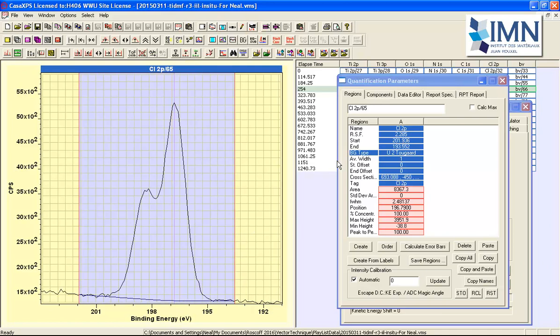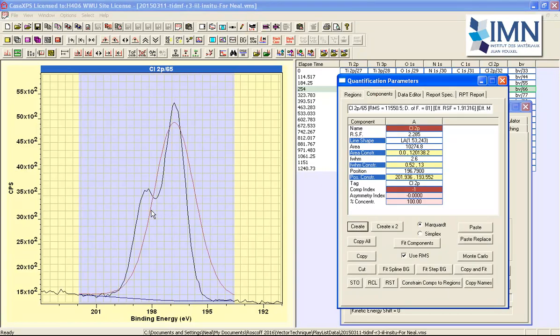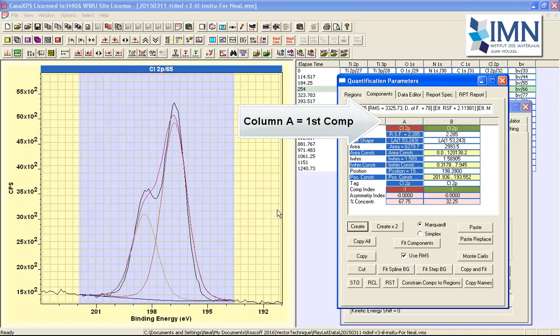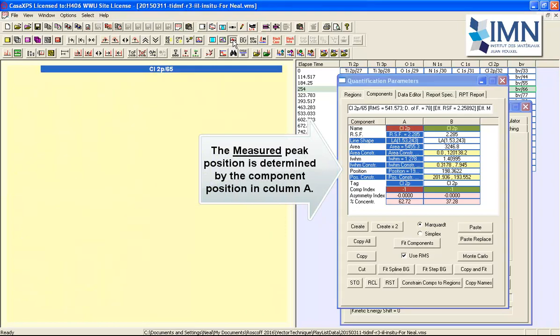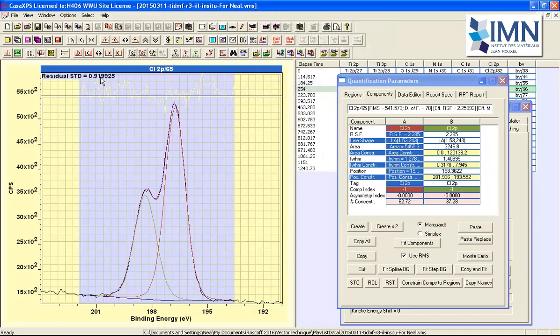So we have a background and we wish to place two peaks. So we'll just adjust the width using the mouse and then define the next peak and say fit. And you can see now we get a reasonable fit to the data. If we look at the residual, this is close to what you'd expect for Poisson statistics. Somewhere below 1 would be the target. This is because we have a multiple detector system here, and hence we don't get the expected unity for Poisson statistics. But nevertheless, this is quite close.